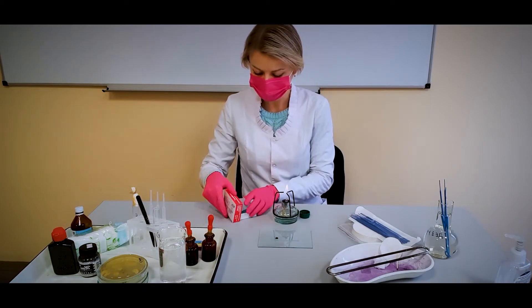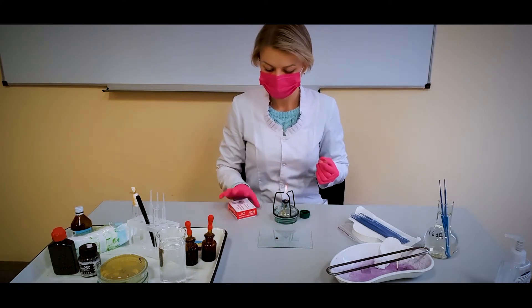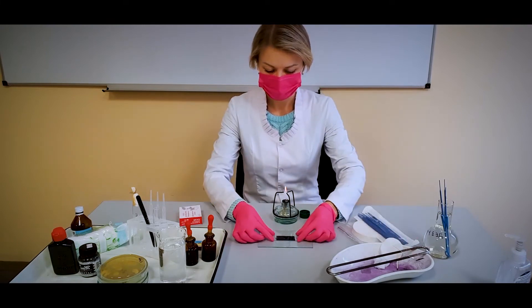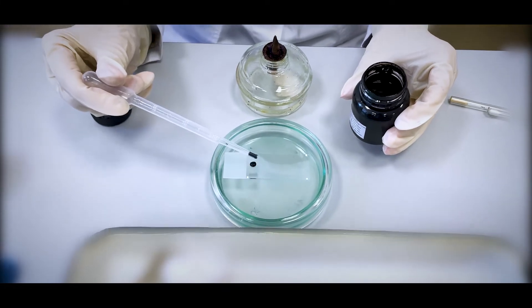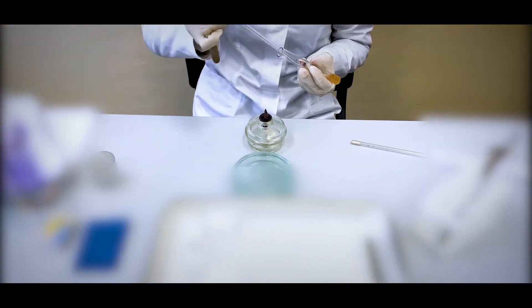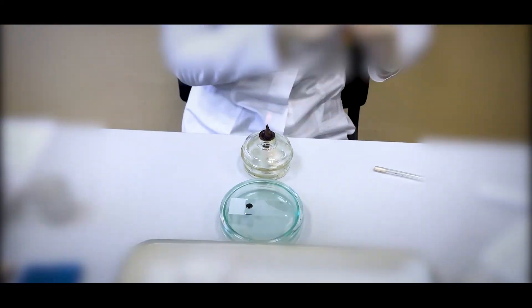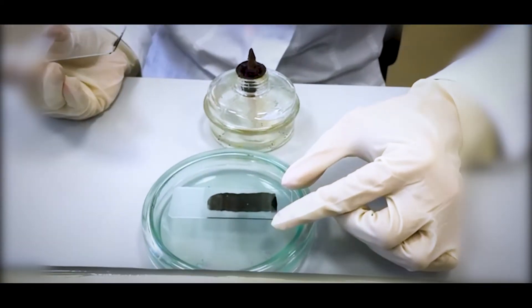Use another slide with a sanded edge to spread the smear. Used glass must be placed in a disinfectant solution — I will place it on the work tray holders because my demo is non-infectious. We can also apply Indian ink first, then use a sterile microbiological pipette to suck up some broth culture of microorganisms and apply it on the Indian ink. This video uses a different, more convenient Burri smear technique, like a blood smear.